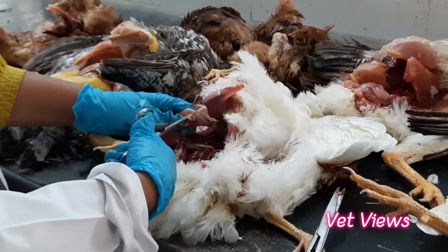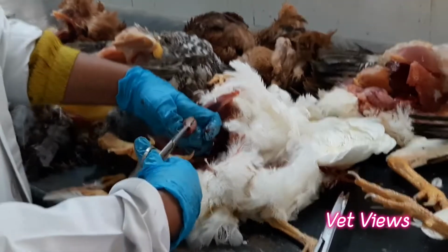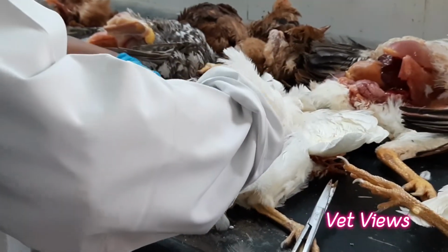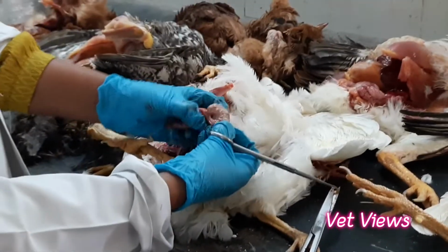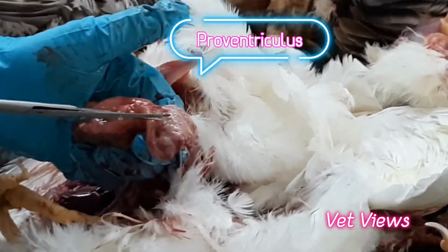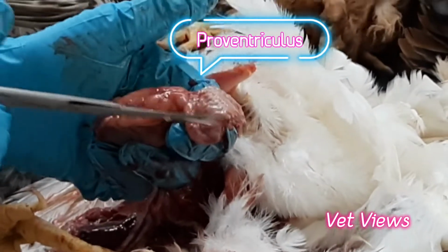So in the proventriculus you have to always see the papillae. Here it is very clear. In case of proventriculitis, you will be seeing the pinpoint hemorrhages just at the tip of these acid secreting papillae. So you will be seeing the pinpoint hemorrhages here.